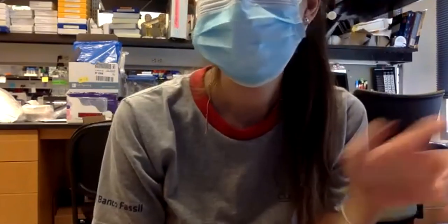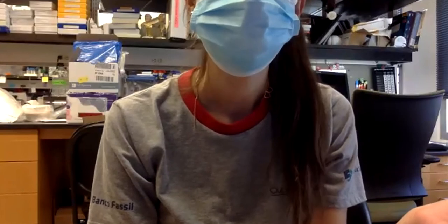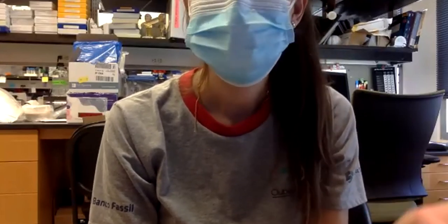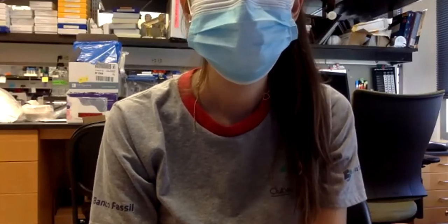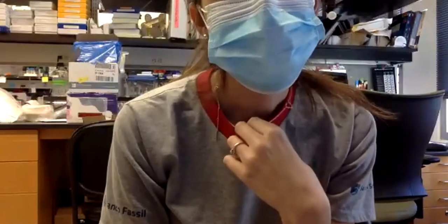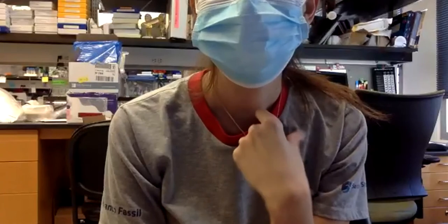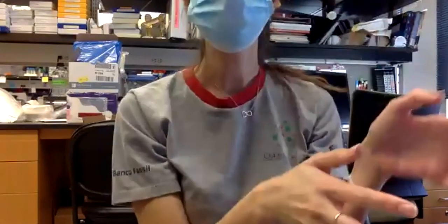It could have other types of bacteria that we don't want, or some fungus. We can have a lot of things growing there. So everything that we use has to be sterile. And usually when we are doing transformations or working with plasmids and bacteria, we work close to the flame so that we have a sterile area to work.